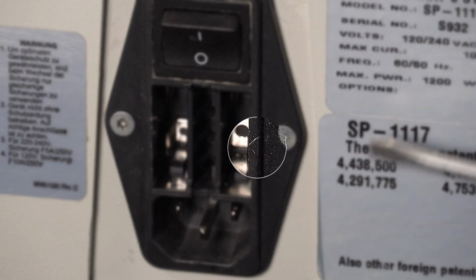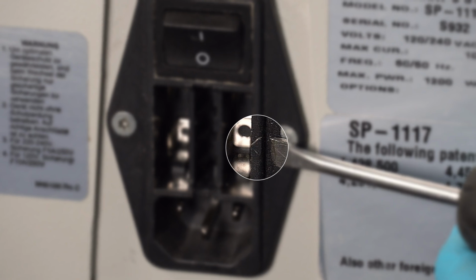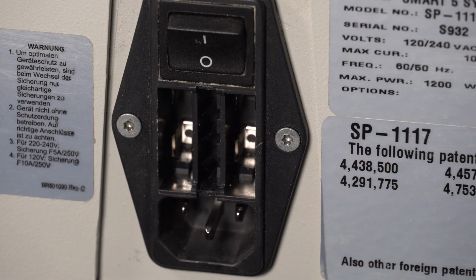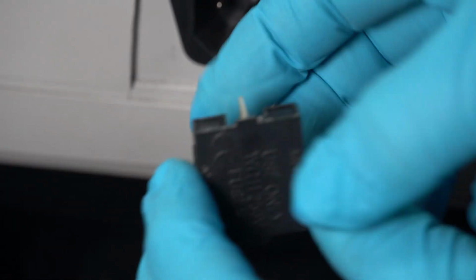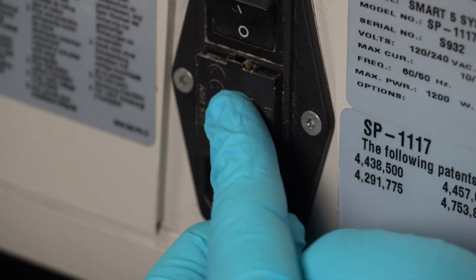On the fuse box at the back of the instrument, there is a small arrow on the right side pointing in where the fuse holder goes in. This arrow indicates what voltage rating will be used. Since we're in the US, we'll be popping the fuse holder back in with the 100 to 120 volt rating on the right side. Just slide the fuse holder back in place until it snaps in, and you're done.